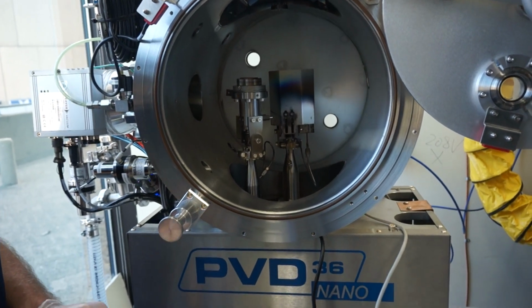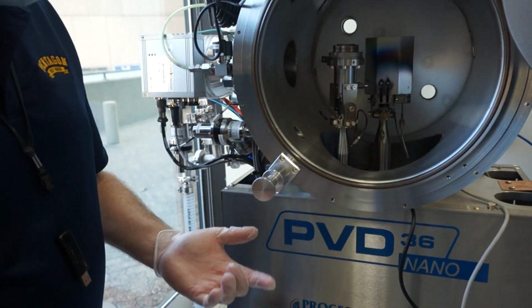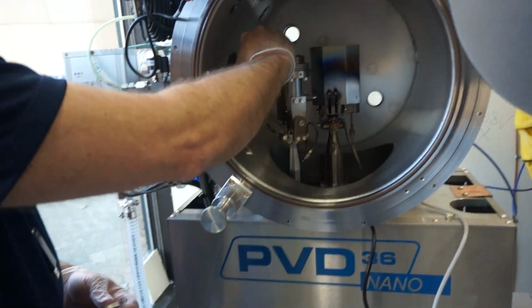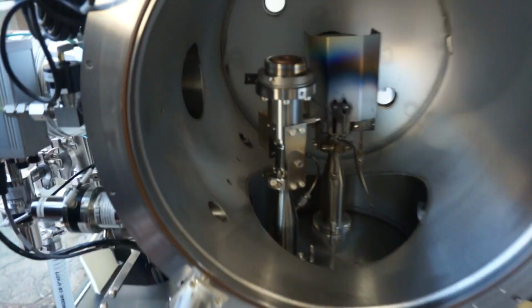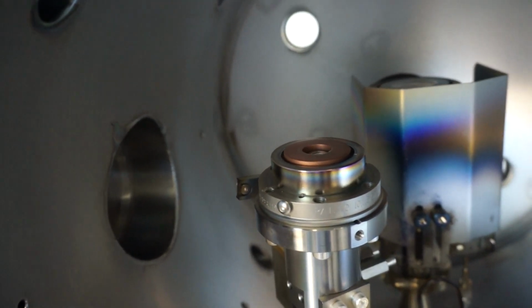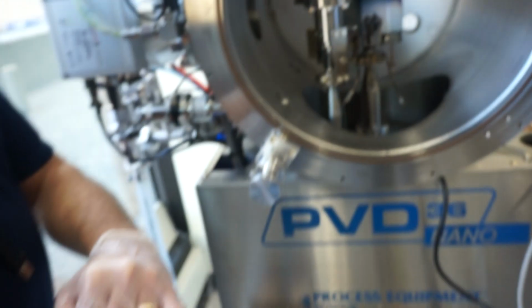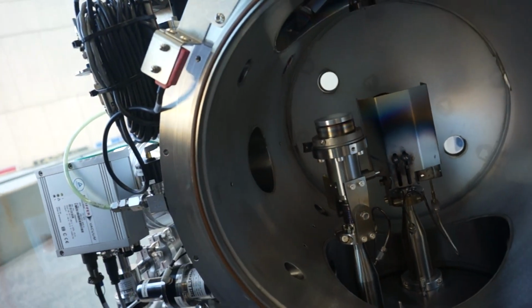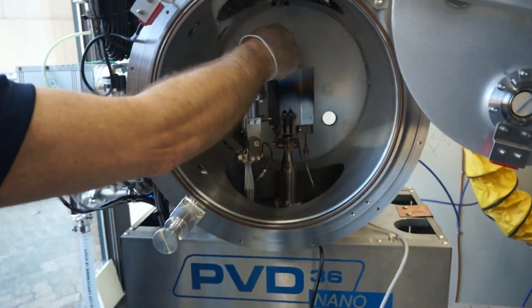But how this attaches is pretty simple. It's basically a magnetic keeper. So you have an outer magnet and an inner magnet within the tool. You may want to take a picture of that. That copper piece is your cooling ring. The back of the target is drilled and tapped for this keeper. And it's just magnetic attraction. It holds it in place. Right on. So pretty simple.